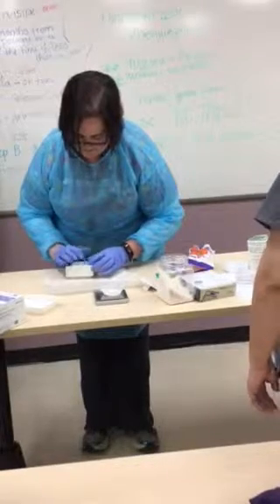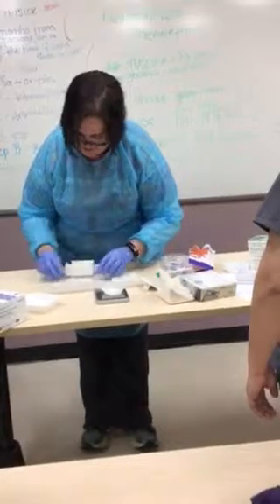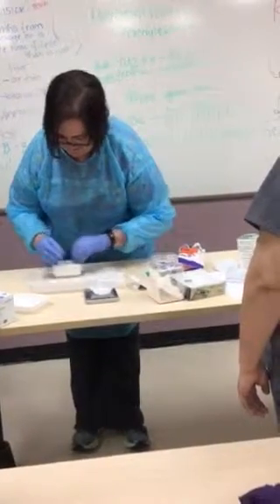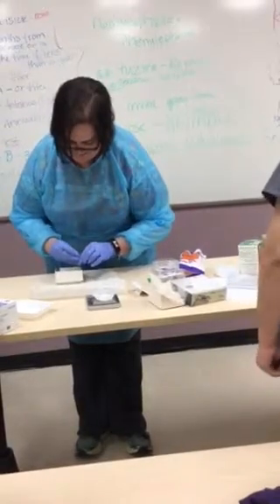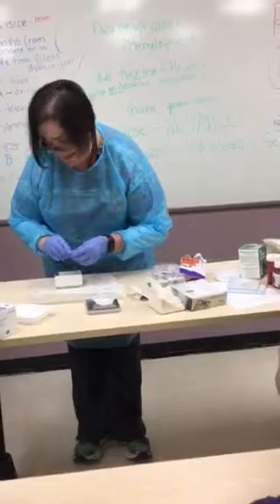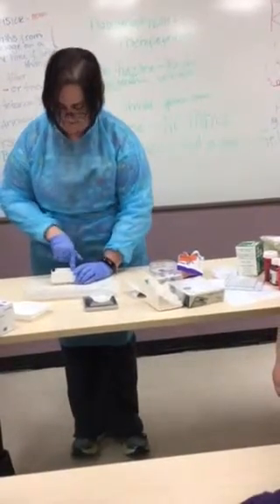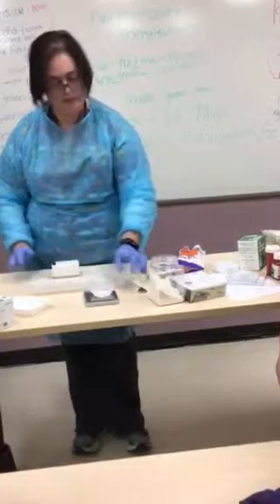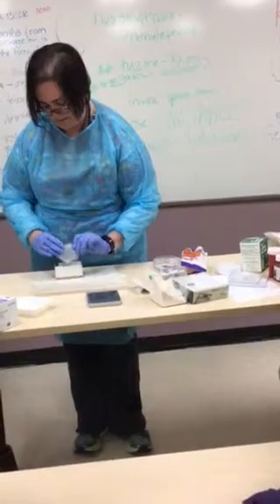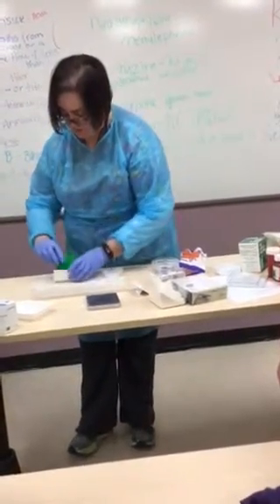Let's avoid heat exhaustion — don't wear triple layers. Just a fair advance warning. Now, in some of the real-world places that you're going to work, they have machines that will do it for us. So I'm going to pour this on top. And I mean, I don't have enough. So I should have gone with the heat.